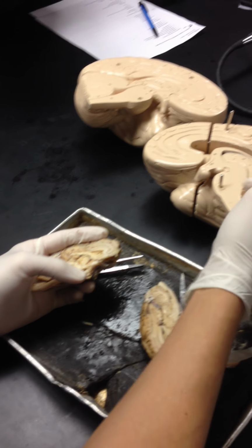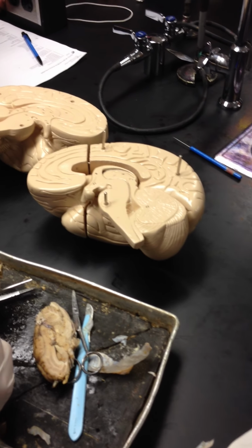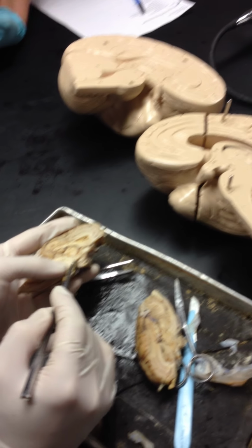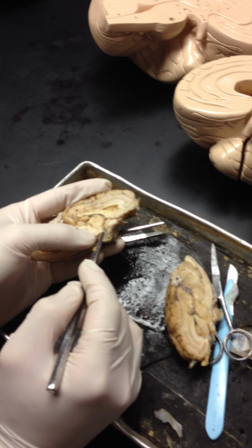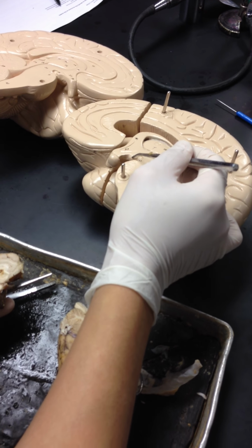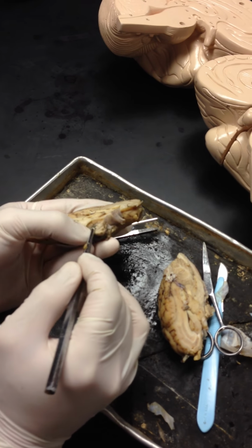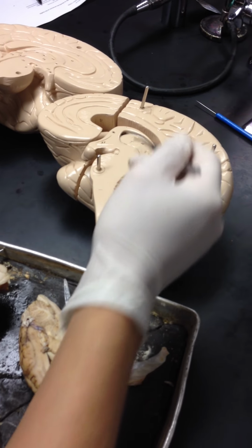Now we move down. In front of it, you have what is called a hypothalamus. Hypothalamus is right here. And how do you know? It's because the hypothalamus connects to the pituitary. If you see the pituitary, you can move above that, and you would have the hypothalamus. All right. Now we move back down. This is a mammillary body right here. So it's going to be in this area right here. I don't want to remove my pituitary, therefore it's really hard to see, but it should be in this area right here.